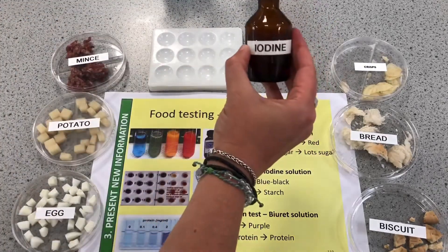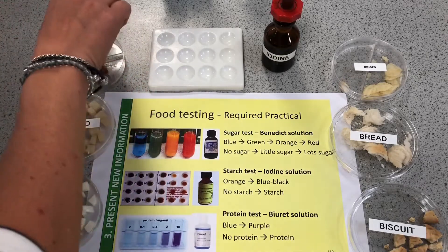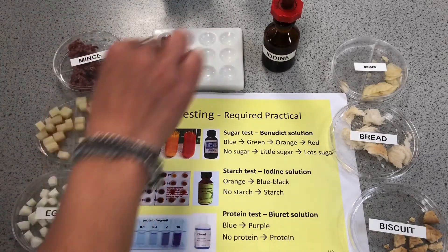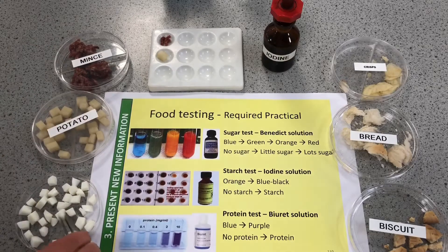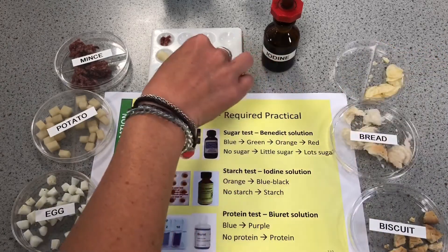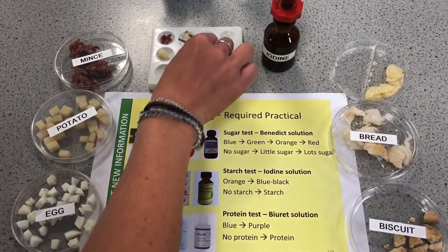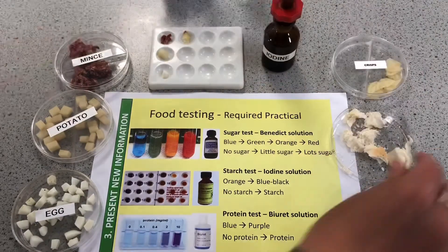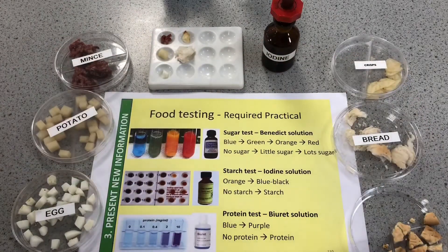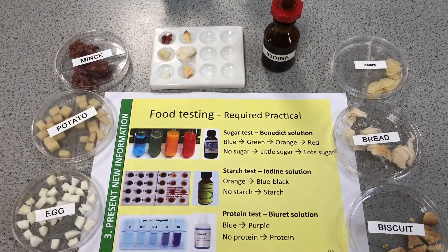For the starch test we're using a spotting tile and iodine solution. I've got six different foods and I'm going to put some of each food into the spotting tile and then add a bit of iodine solution. If it stays that orange color there is no starch; if it changes to a blue-black color there is starch. We use iodine solution so much — we also use it in testing for starch in leaves — it's quite a familiar chemical.